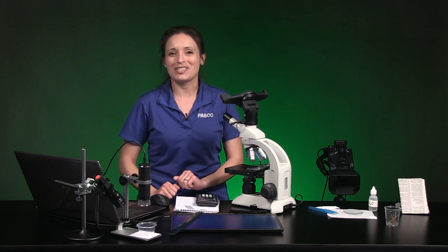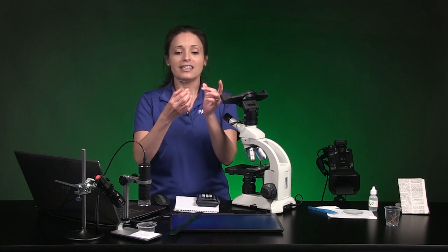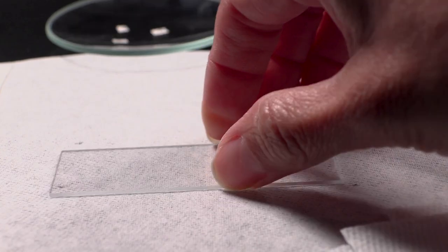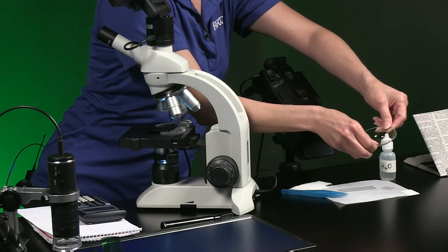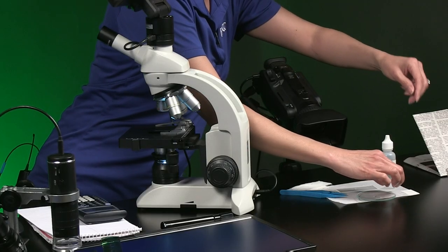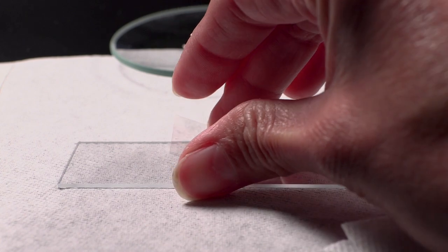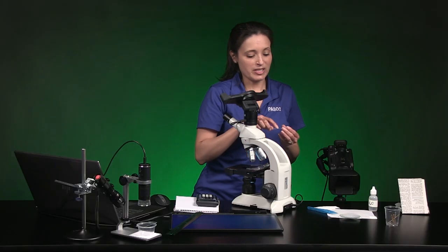Grab a clean glass slide and coverslip by the edges and inspect it. If it's chipped or cracked, let your teacher know and discard it in the broken glass container. Choose one E and set it in the center of the slide. Then pick up the coverslip by its edges and center it over the letter. Now my slide's ready.